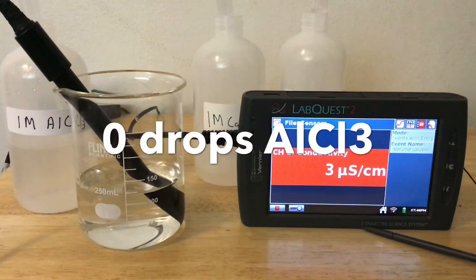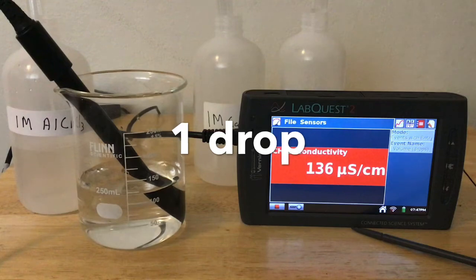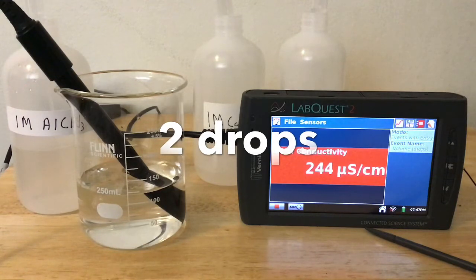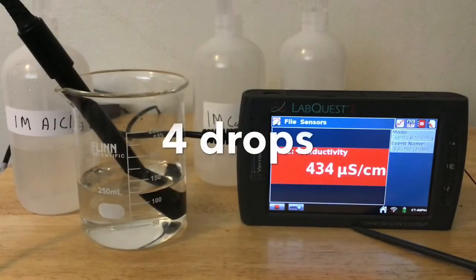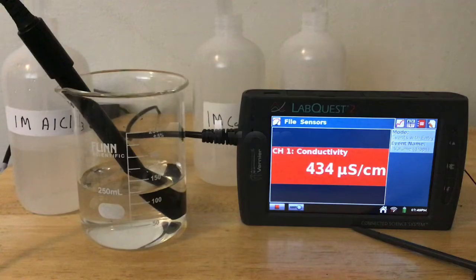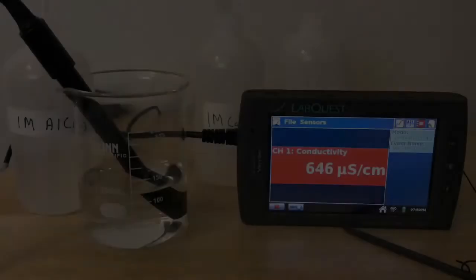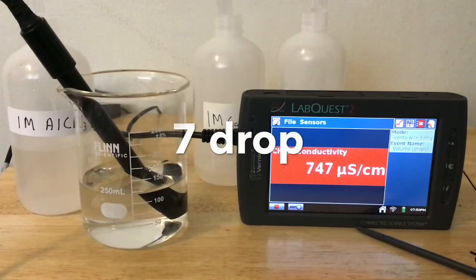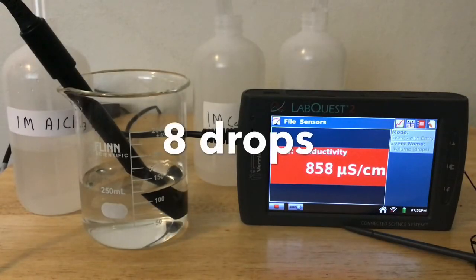Now we'll begin the aluminum chloride. This is our initial measurement. 1 drop of aluminum chloride has been added. 2 drops. 3 drops. 4 drops. 5 drops. 6 drops. 7 drops. 8 drops.